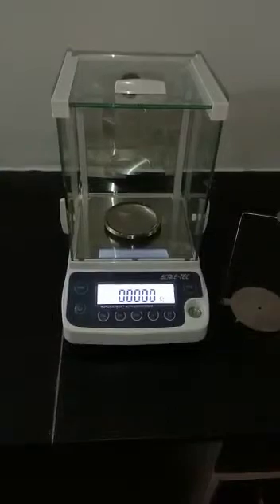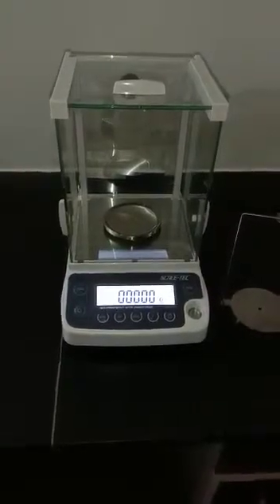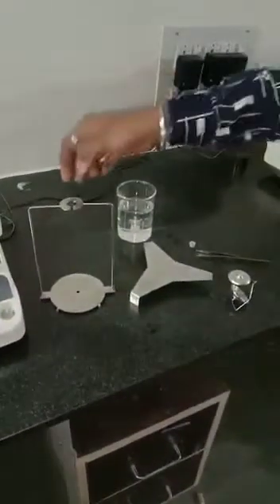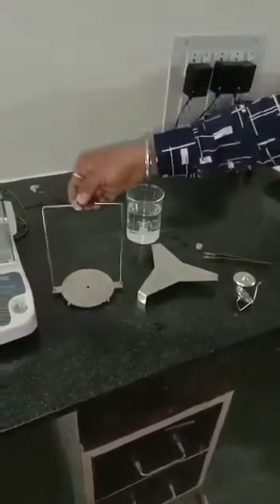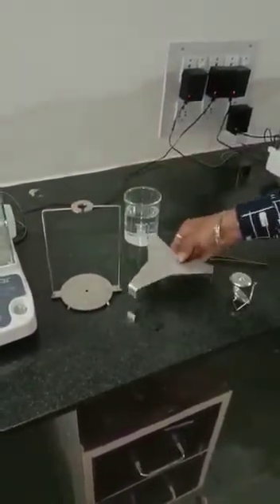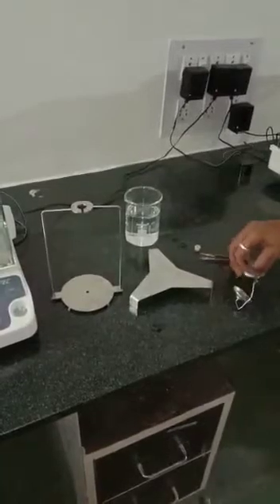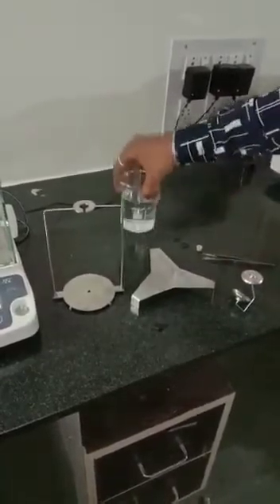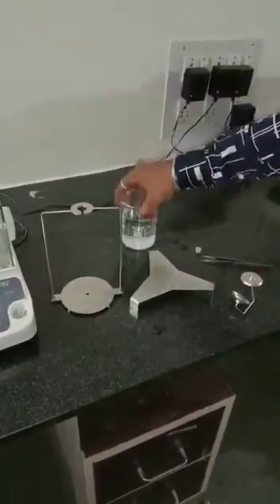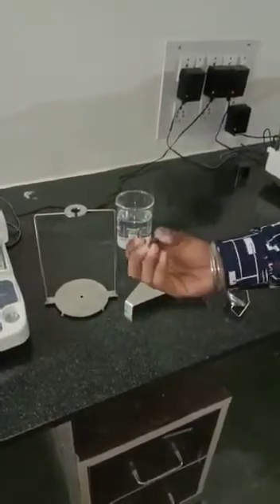First of all, I have a density kit here. What does it include? First, a weighing assembly, then a tripod stand, then a hanging plunger, and at the end a beaker filled with water. For an example, I have one material of which I will find the density.